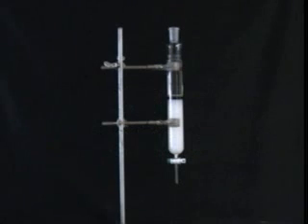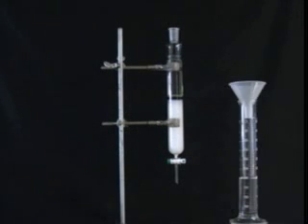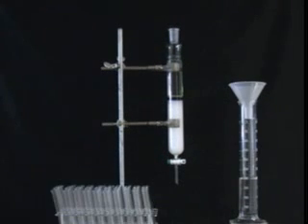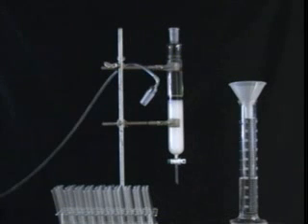Once your sample is loaded on the column, you must begin running it immediately, and it's a good idea not to take any breaks until it's through. Before you start, make sure you have an adequate supply of your chosen solvent mixture and a nice big rack of test tubes.